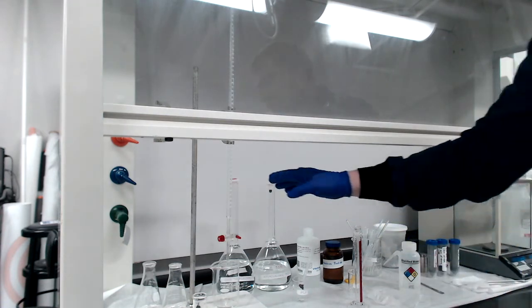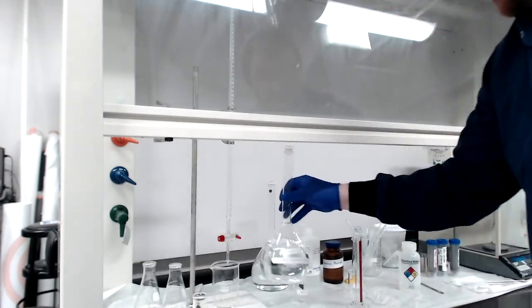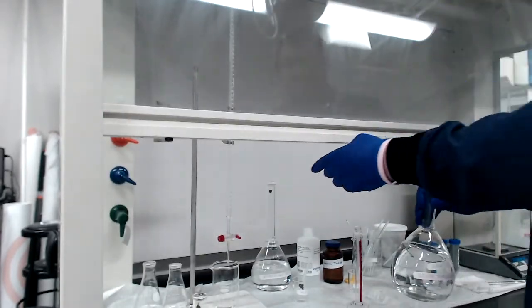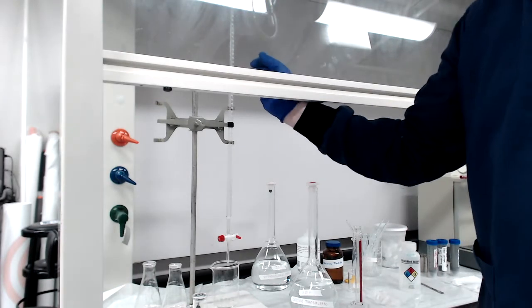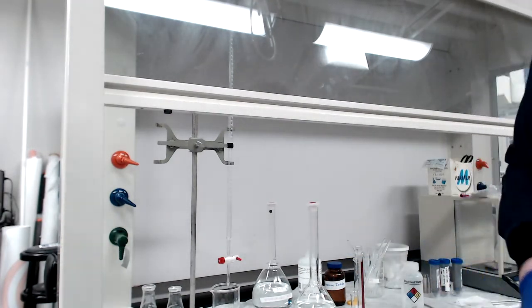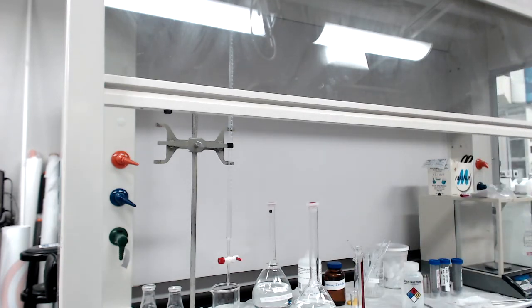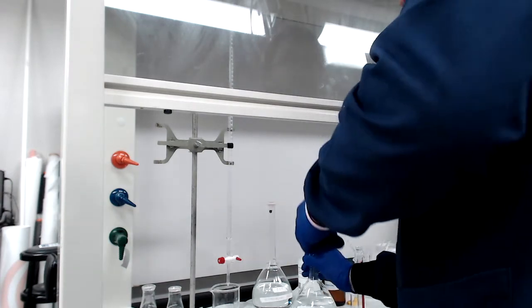For the next step, we need to get the burette ready. Right now it's empty, so we need to add the sodium thiosulfate — the 0.03 molar or normal sodium thiosulfate. There's a funnel at the top of the burette so I can pour the thiosulfate in. I want to pour at least 10 milliliters — the burette holds 50 milliliters. I'm going to make sure it's closed so it doesn't just go straight through, and then add the thiosulfate.